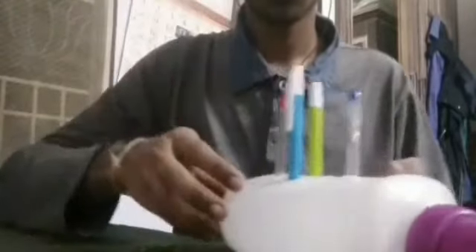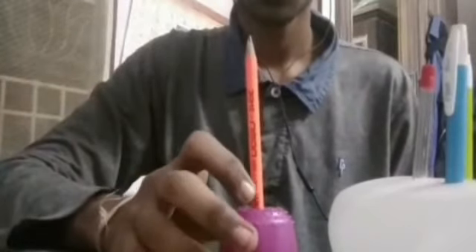So this is the test tube which is shown here, and then he is demonstrating the Bunsen burner. This is a model of a Bunsen burner. Then comes the inoculating loop, which is represented by a refill rolled with paper. Then comes the petri dish, the model of a petri dish with a lid.